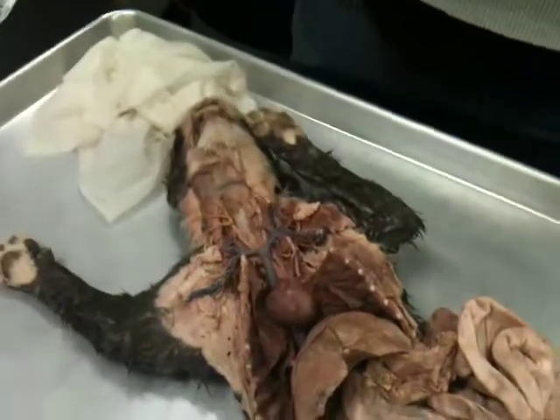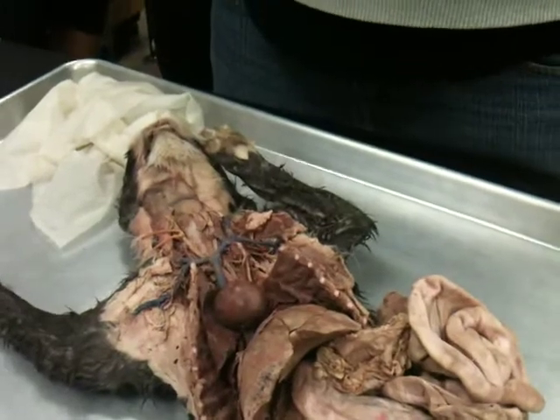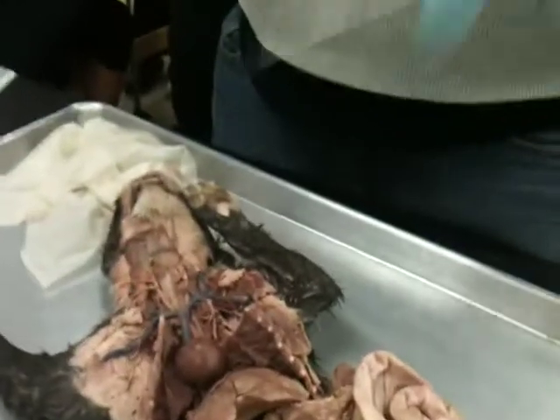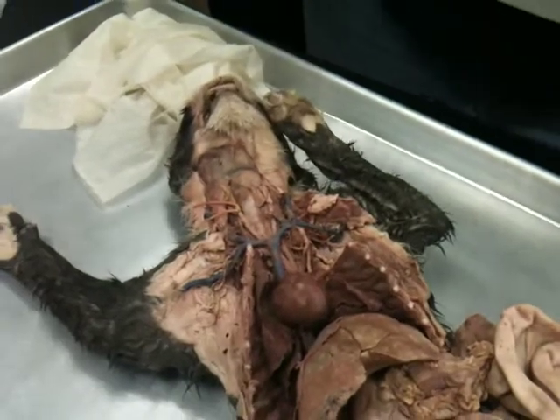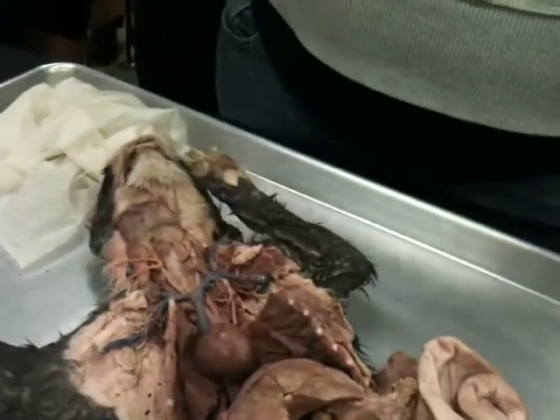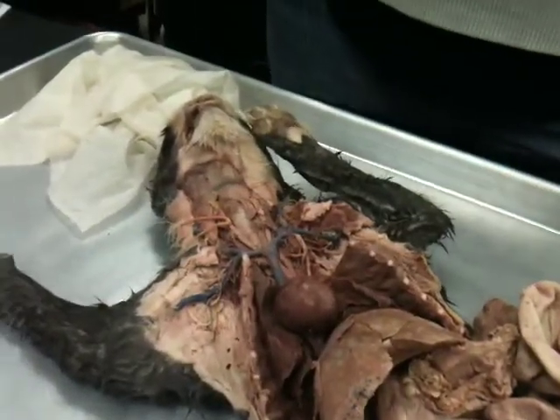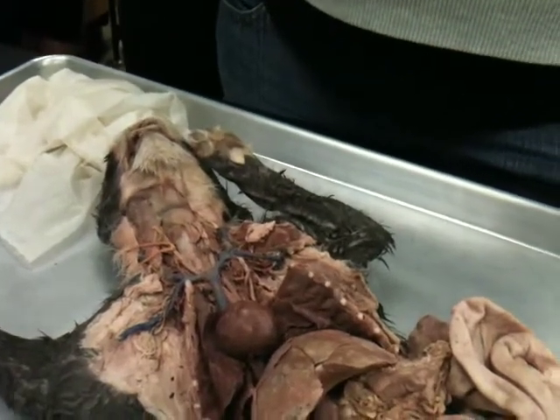Right. So the same thing, we're going to start with the major artery, which is the aorta, connecting to the left ventricle. These right now are colored blue or red, so at least you'll know if it's a vein or an artery based on the color, for the most part. I wouldn't pin the right femoral vein because it didn't take. I would pin the left one if I wanted to see the femoral. But just because they're colored red and blue doesn't mean you don't have to write whether it's an artery or a vein. I'll take off the point if you don't write the name that it's an artery or a vein.